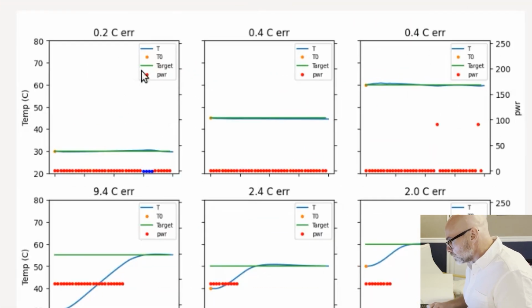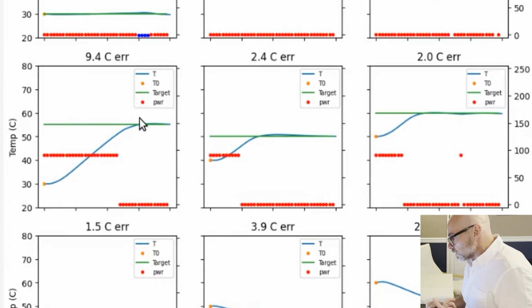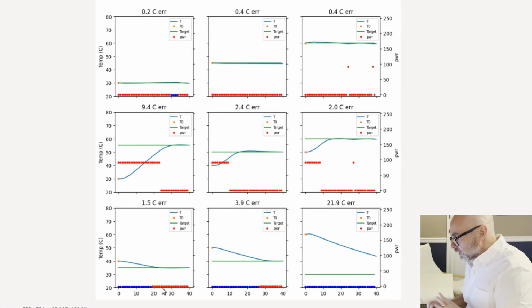So here we have the green is the target temperature in all these different runs, and then the blue is the simulated temperature, so what it actually is, and then the red and the blue down here again are the controls. So the blue here is when it's plunged. This is just power off. And then up here, the higher red is when more power is being applied, but it's not plunged in. And so it's able to, rapidly, at around 1 to 2 degrees per second, both cool and warm, get it down, which is pretty cool. And I'll show that in a second. But yeah, so those all look good.